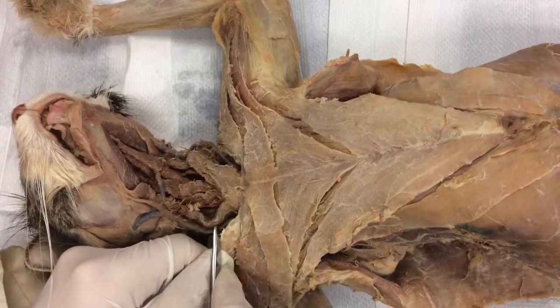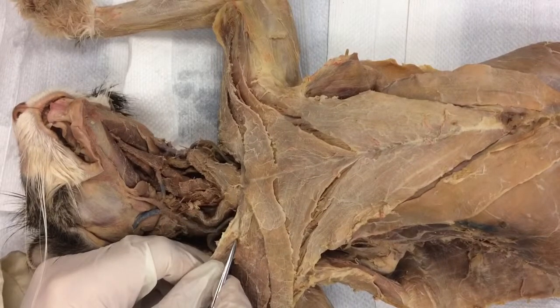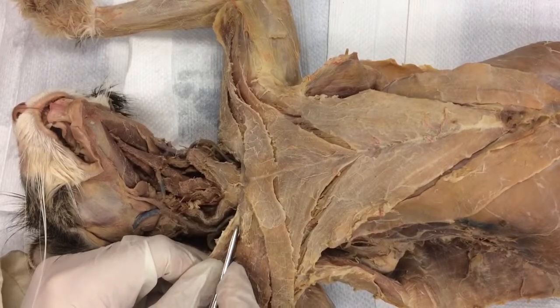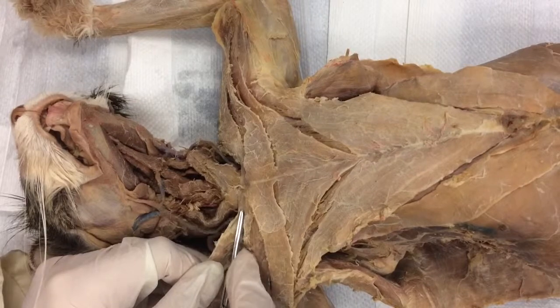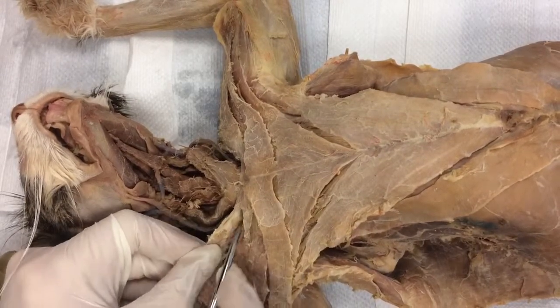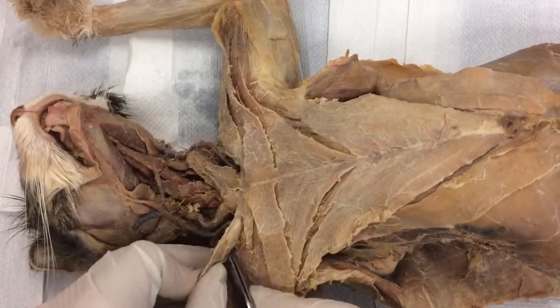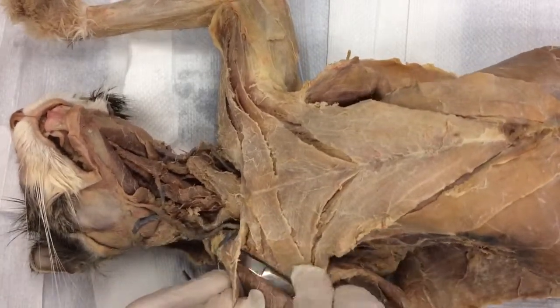Now that's open. You can see all this white right here — I want to disconnect the clavicle from the sternum. Watch — it just came off. Beautiful. And then I'm going to keep dissecting until my scissors pop out.